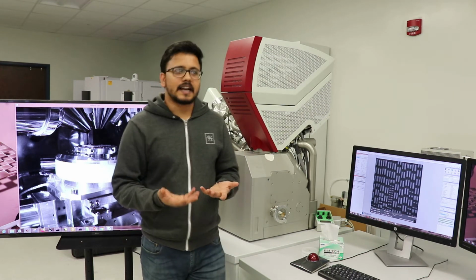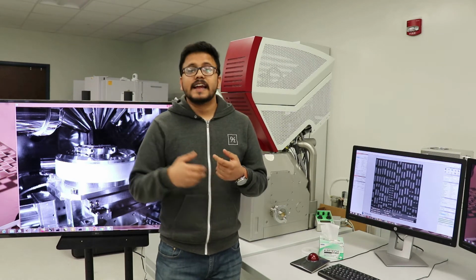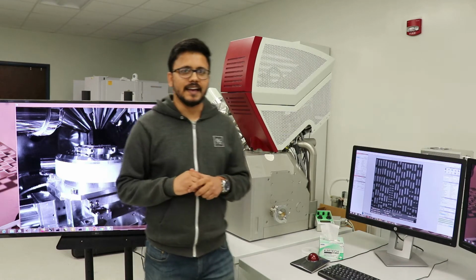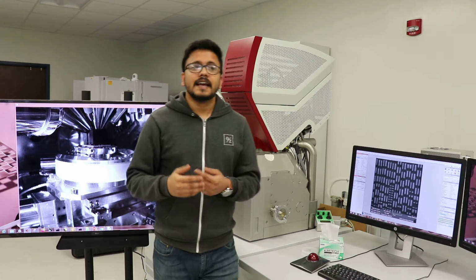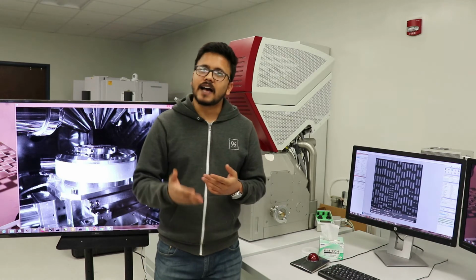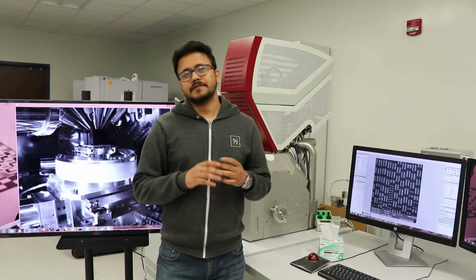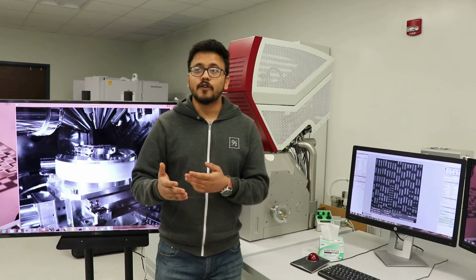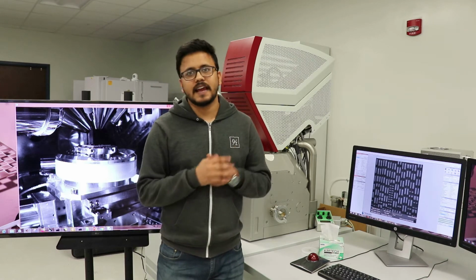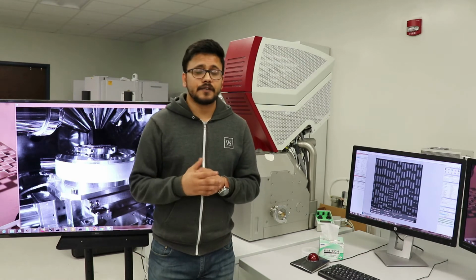Like if I hit a ball with another ball, it will remove that previous ball from its location. That's exactly what is happening over here. When the ion beam comes over the sample surface, it removes the atoms from there, and this is how we remove the material from the surface. Now, this can be used in various different applications. I just gave you the simple idea of how we can remove the sample's area made up of silicon, but we can use it for other purposes.